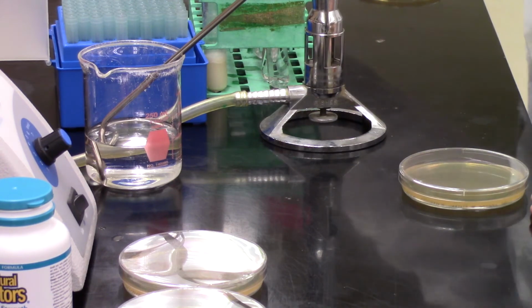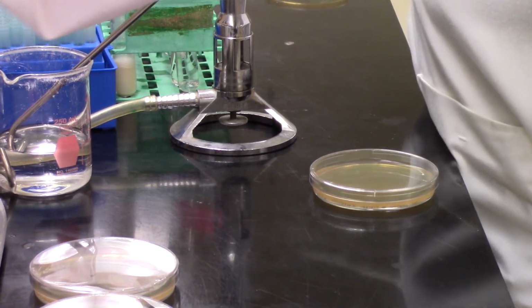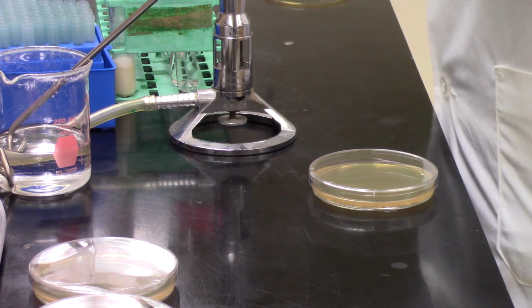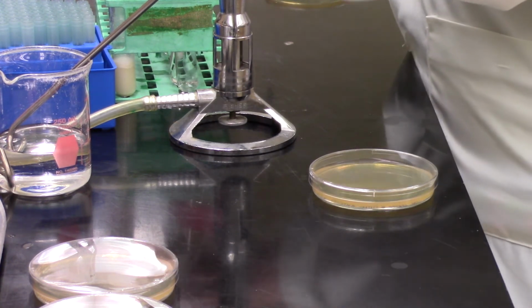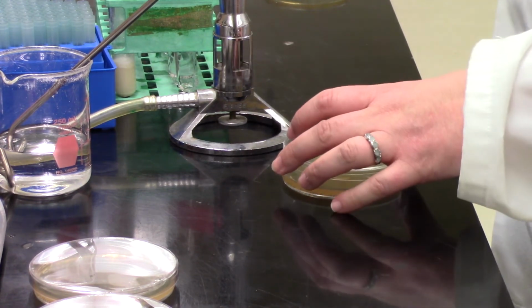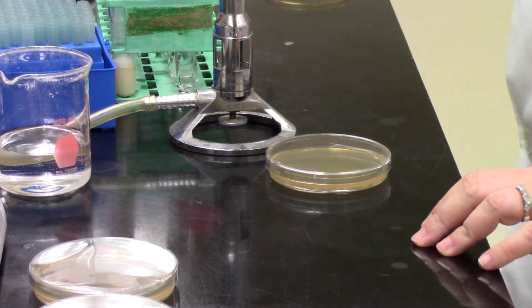Just one more. Yeah, okay, we'll do one more for you guys just so that it's nicely cemented in your head. Remember, you aren't going to be doing this exact lab. When you come into the lab, you're going to be working with a known bacterial sample, just E. coli, in order to practice your spread plate and pour plates. But we'll be actually preparing lots of different plates from a couple of different samples for you guys of these probiotics, either yogurt or capsules, and you'll get a data set so you can start crunching the numbers and figuring out which had the most bacterial cells in it.